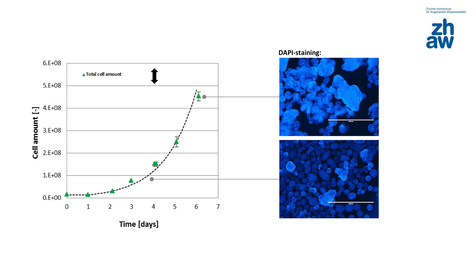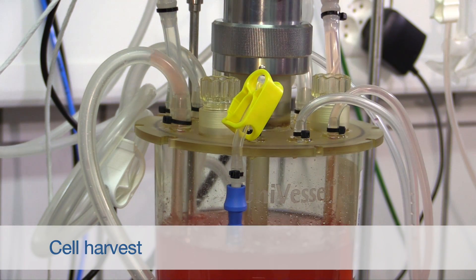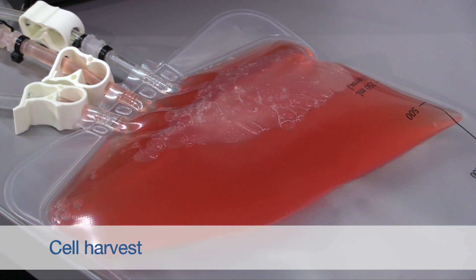The whole bioreactor content is now transferred to the harvest bag using a peristaltic pump.